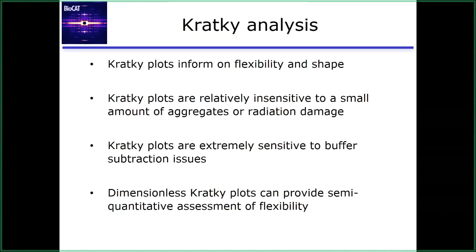So in that way, you can use them to assess buffer subtraction. If you're expecting, say, something very rigid and it doesn't go back down, it can tell you that maybe you have a buffer subtraction problem. But this is a good way to get a feel for what you're looking at in the solution.